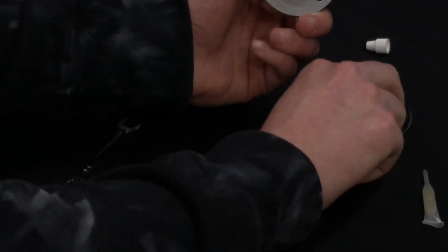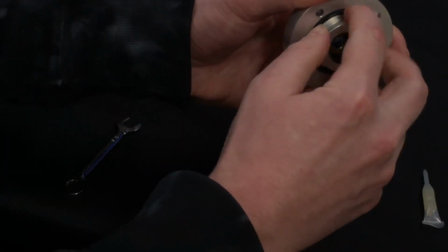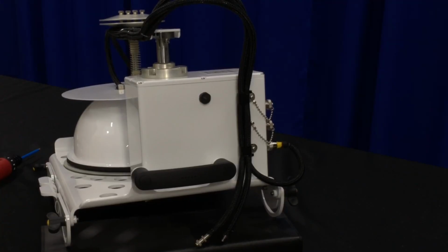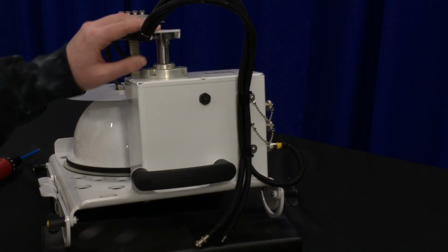And once you're done with that, don't forget to add the O-ring to the bottom. And then you're ready to go. Next step is going to be to remove the chamber and bowl.